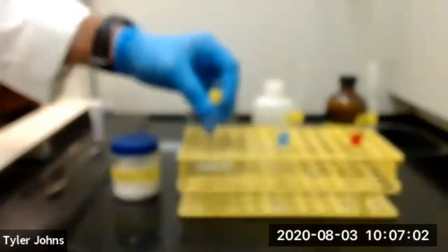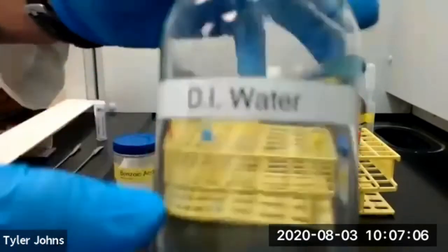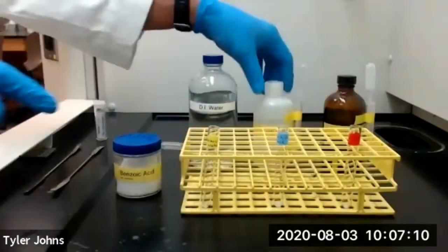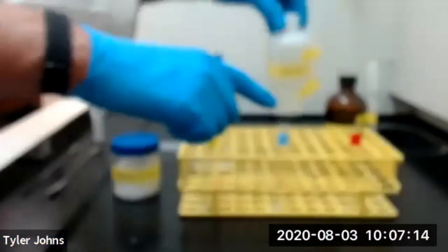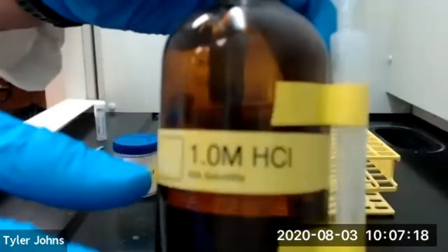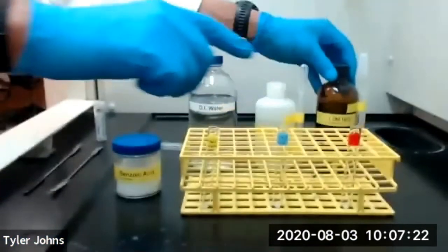What we're going to do now is add 1 milliliter of deionized water to our first test tube, 1 milliliter of 1 molar sodium hydroxide to our second test tube, and 1 milliliter of 1 molar hydrochloric acid to our third test tube.